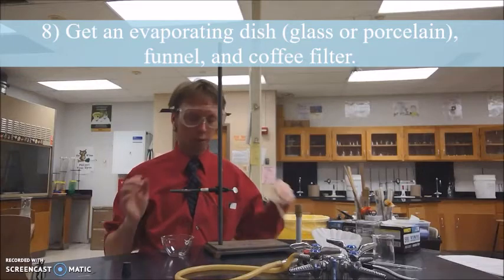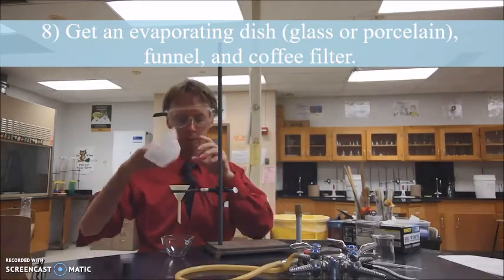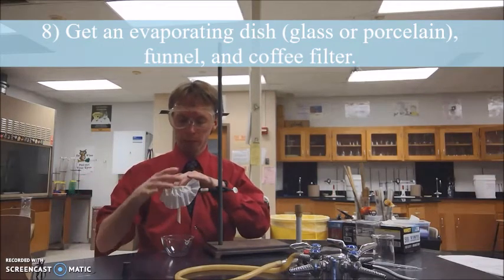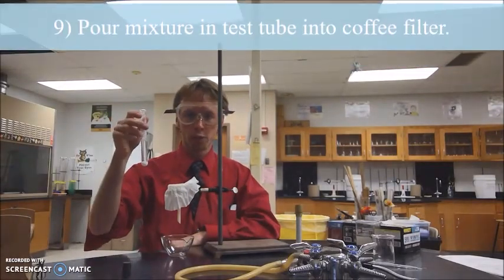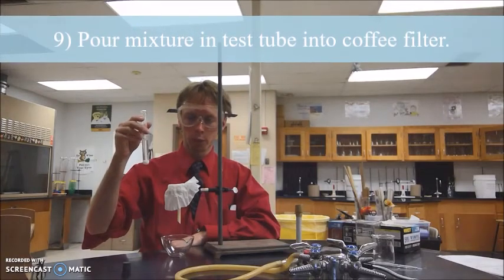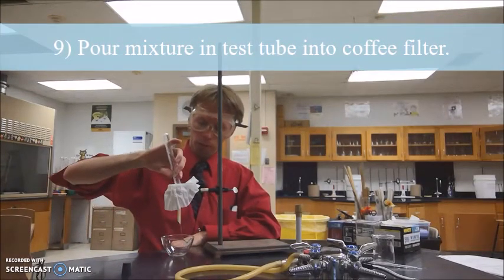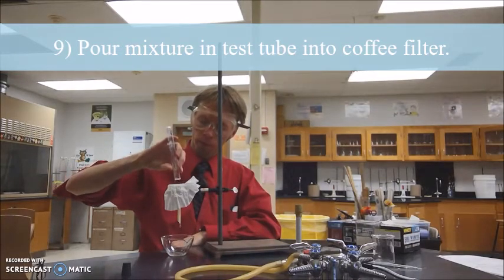Then you're going to get a funnel and a coffee filter. You're going to put the coffee filter into the funnel and sort of wrap it around the outside so it sits nicely on its own. Then you'll take your test tube of your mixture and pour it into the coffee filter.